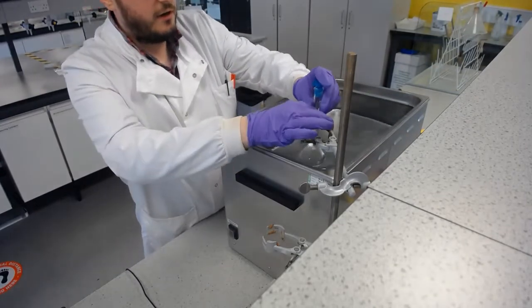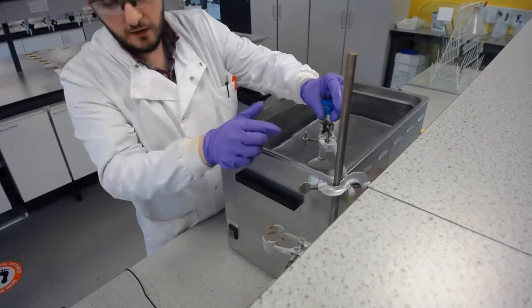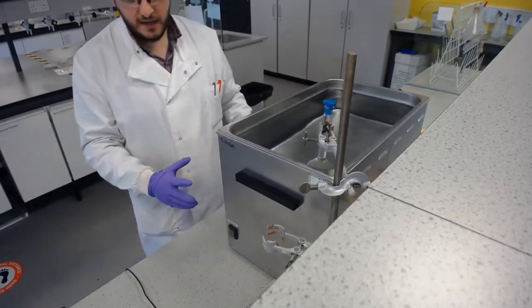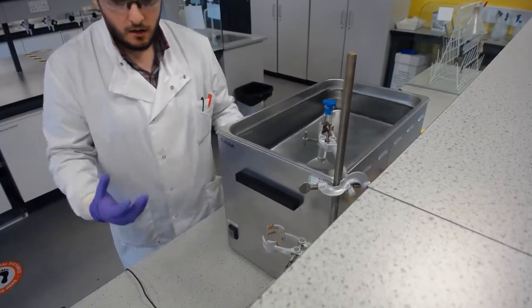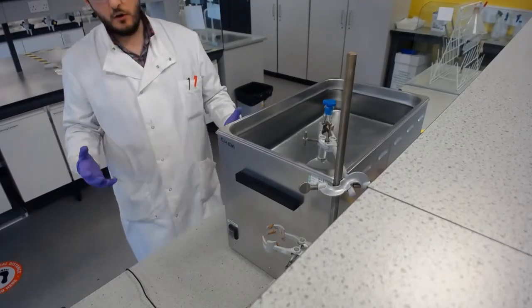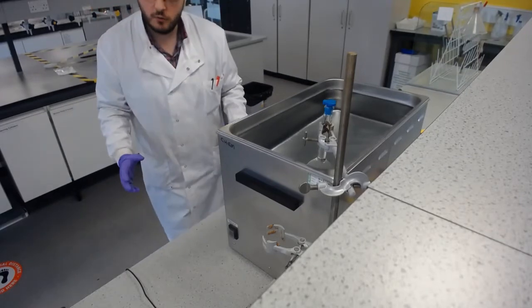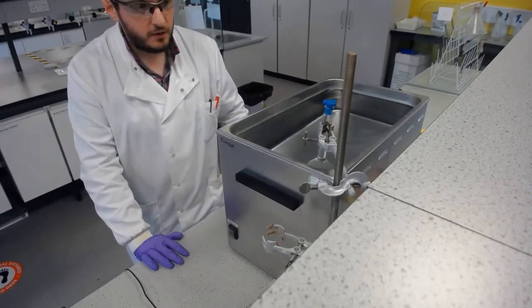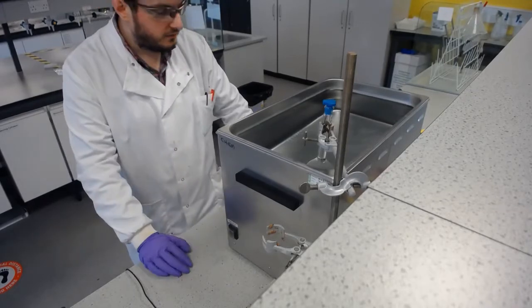Now, whilst that is very useful, so I don't have to stand here, that's great. It's also because it's dangerous to put your hands into a sonicator bath. So the ultrasonics that it's creating is causing cavitation in the water and in the solvent that we have. That cavitation is really helping to get the drug into solution, but it can also cause cavitation and nucleation of gases in your blood if it was at a high enough power. Now, I don't know if this one is at a high enough power, but a general rule is you don't hold with your hand or put your hand into anything into a sonicator bath. You let a clamp do the job because you don't want to risk any health issues.